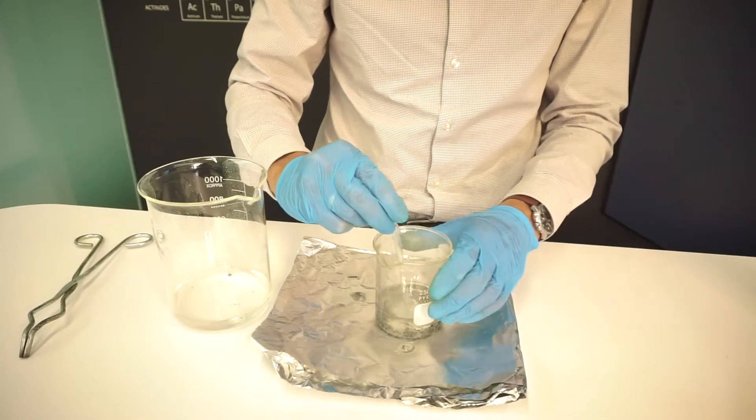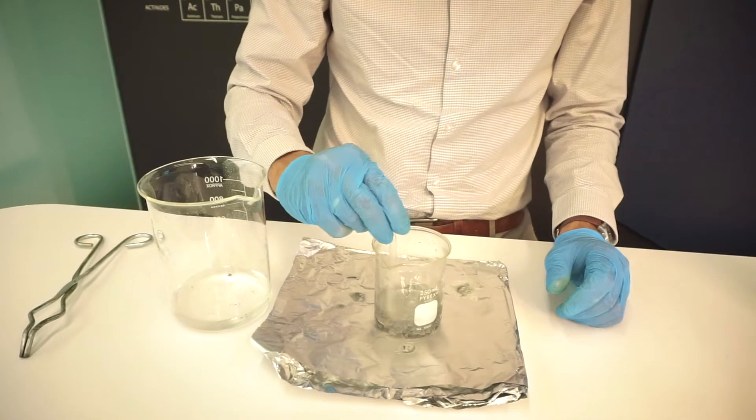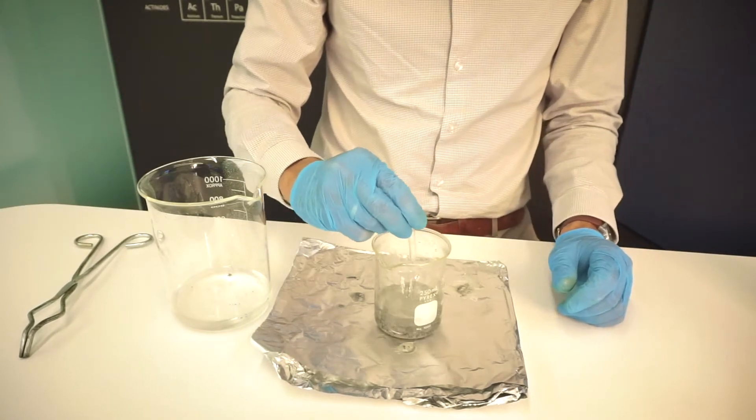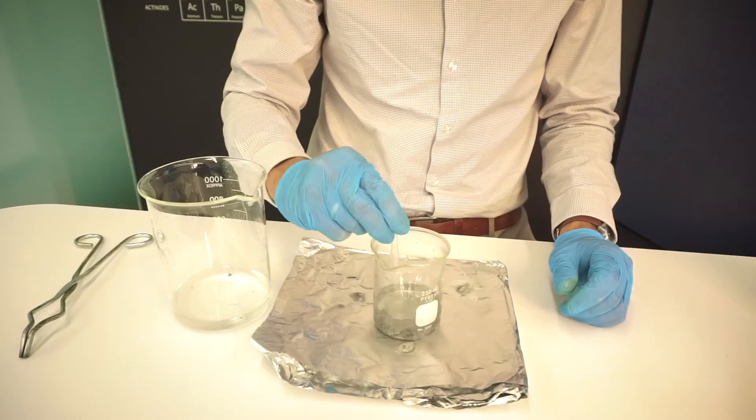And it's a little bit hot. I just took it off the hot plate, so I'm just stirring it around. And so sodium hydroxide and zinc metal react slowly, and at elevated temperatures to make sodium zincate.